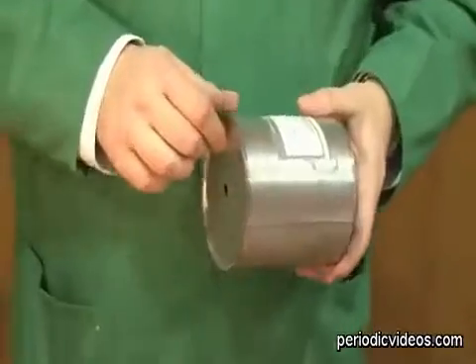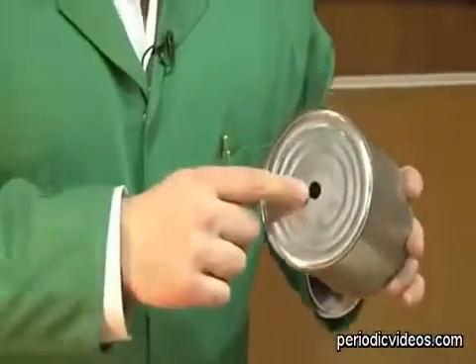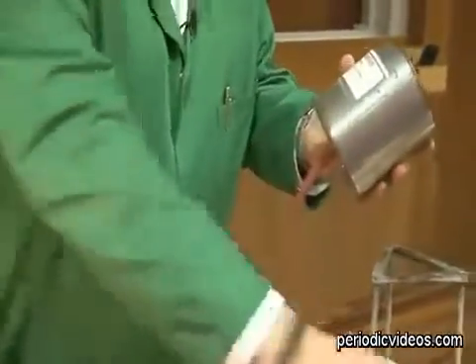So what I thought we'd do is investigate today an explosive mixture of methane and air. And to do that, we're going to use this very crude device. It's just simply a can. Now, me and Neil have doctored it slightly by drilling a couple of holes. Okay, one in the bottom and one in the top. Now, what I'm going to do is fill the can from my gas tap. So I'm going to fill it up with gas.